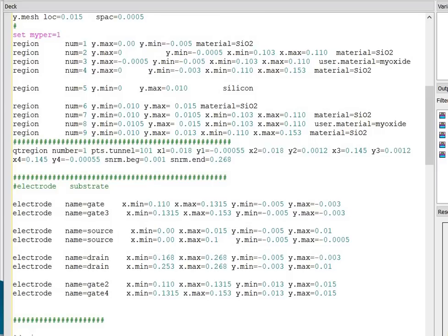Next I have defined the quantum tunneling meshing. You can define the quantum tunneling meshing in two ways. I have already explained in my previous video. If you don't know how to define the quantum tunneling meshing, please follow my previous video to understand how to define quantum tunneling meshing in the TFET structure.